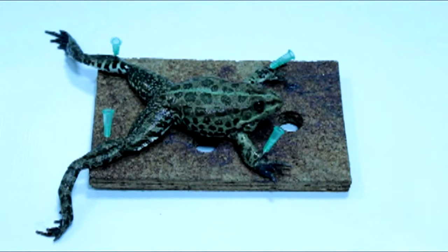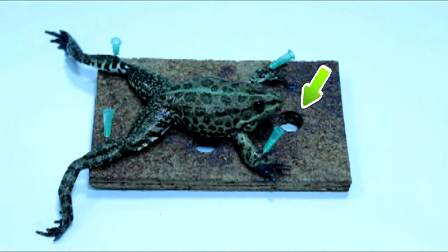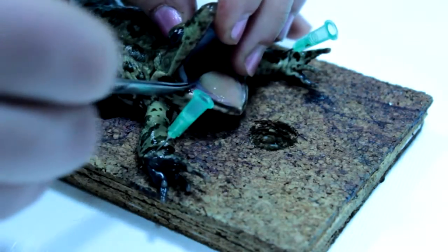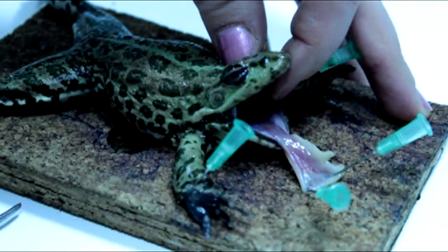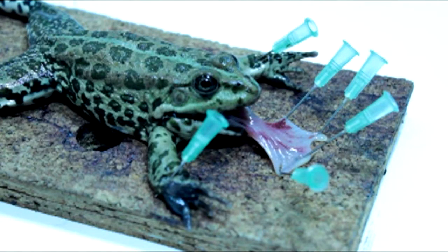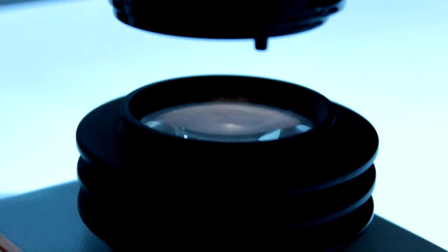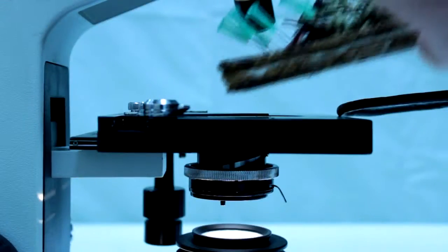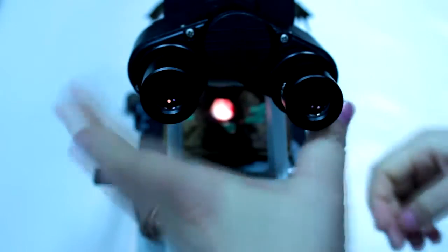First of all, we fix the frog from the back to the top so that the cutting edge of the mandible is located at the edge of the plank hole. Using tweezers, we open and pull out the frog's tongue. This is stretched over the hole and pinned so that it won't interfere when placed subsequently on the microscope. With the pins retaining the tongue, it should be placed at an angle to the center. Next, we place the frog attached to the board under the microscope. Under low resolution, we will explore circulation in the vessels of the tongue.